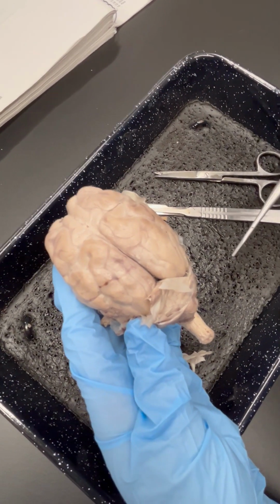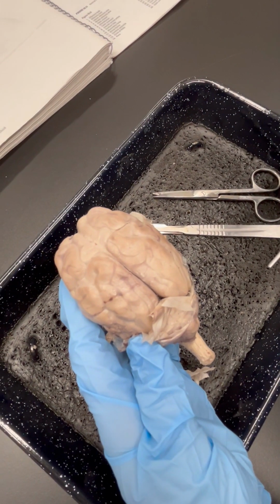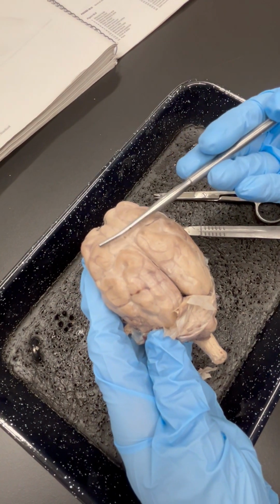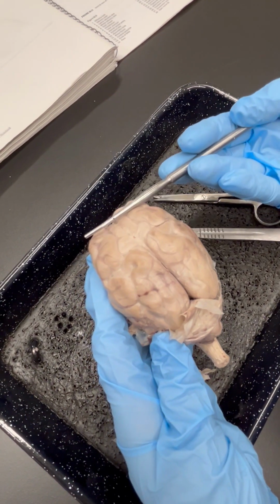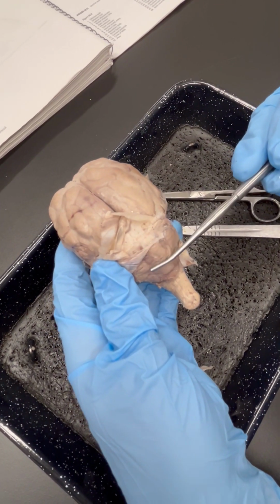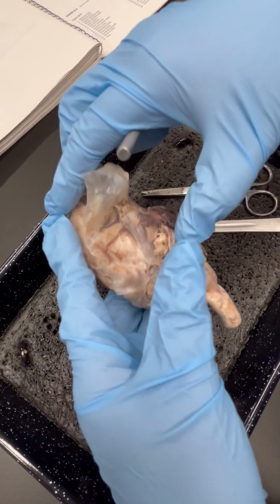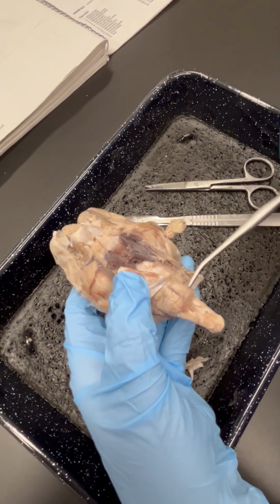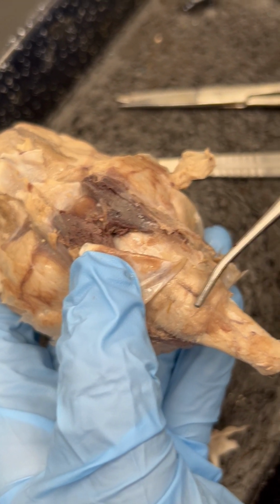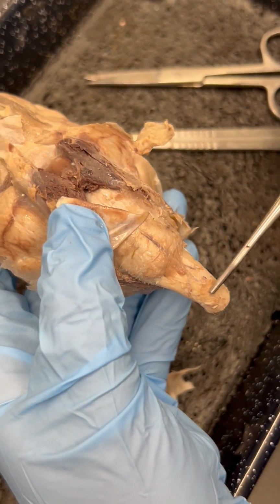First, we're going to discuss the three main parts of the brain. This isn't associated with any figure, but is just to get you acquainted with the organ. First we have the cerebrum. Next we have the cerebellum. And third we have the medulla oblongata, which we see best from the ventral side of the brain. The medulla oblongata then has the spinal cord extending from it.